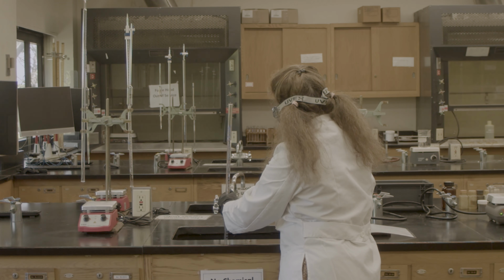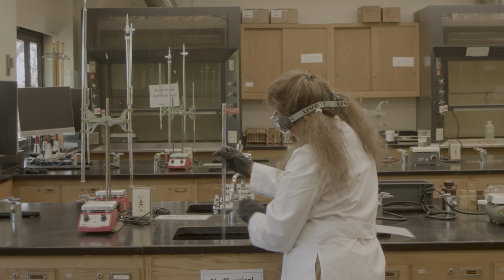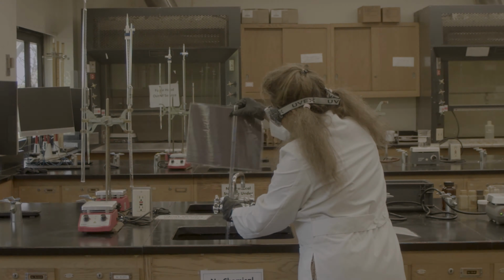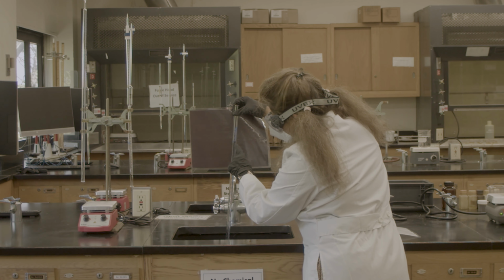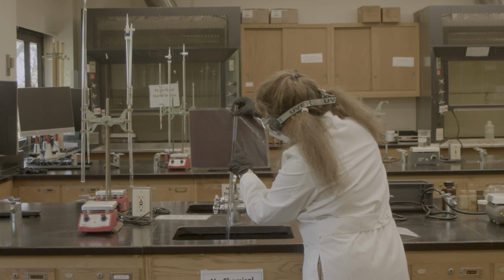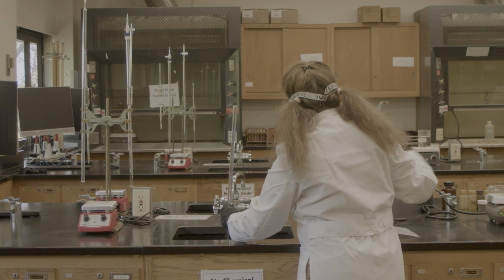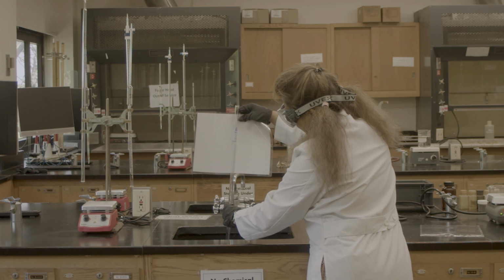So this is my meniscus curve. If you see the background, this is my meniscus curve. The bottom of the meniscus curve should touch the 0. Then I can get the exact amount of 50 milliliter of sodium hydroxide.